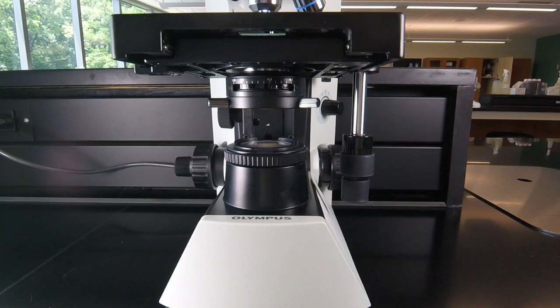Once we have the slide in the slide holder, we have to make sure that we have enough illumination to be able to see the specimen clearly through the microscope. When we look at something magnified a thousand times, it takes a great deal of light to illuminate that object.